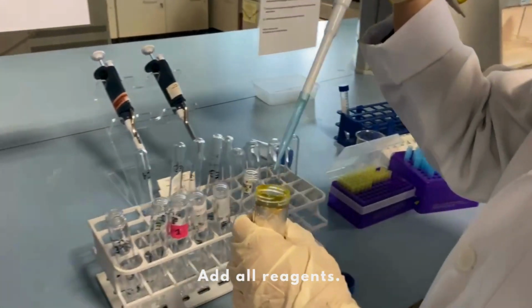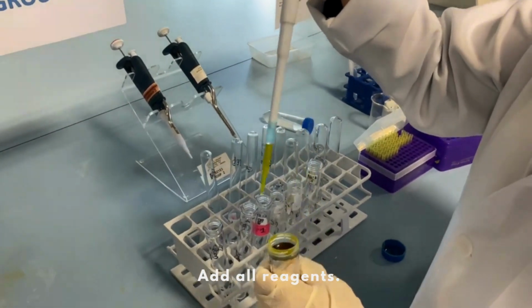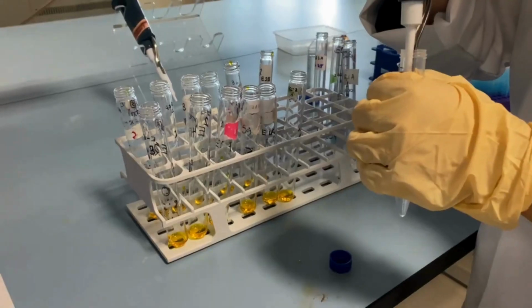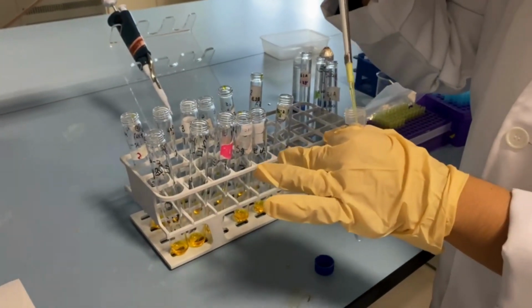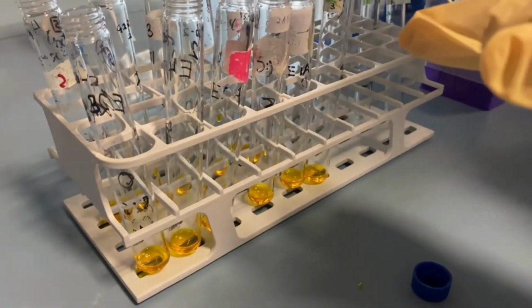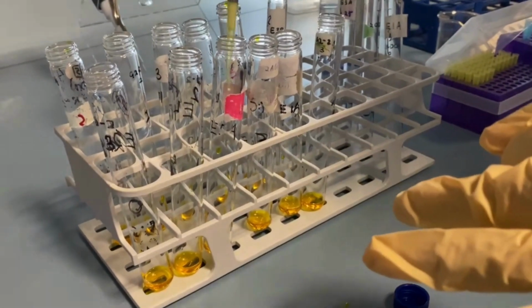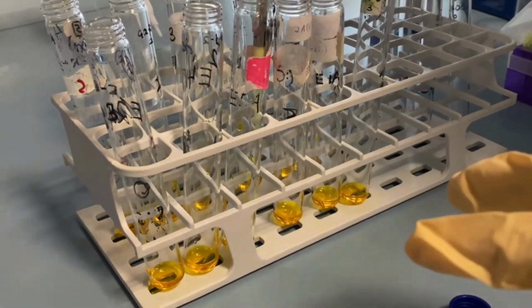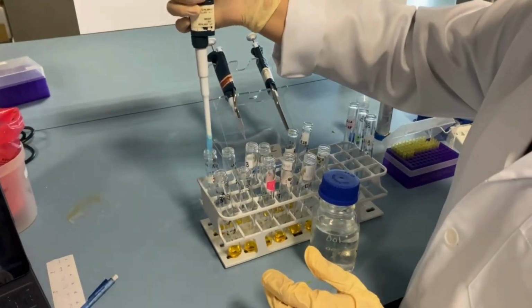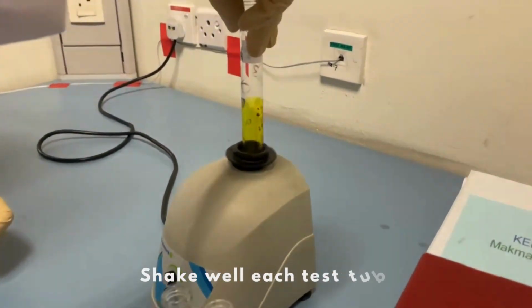Add all reagents. Shake well each test tube.